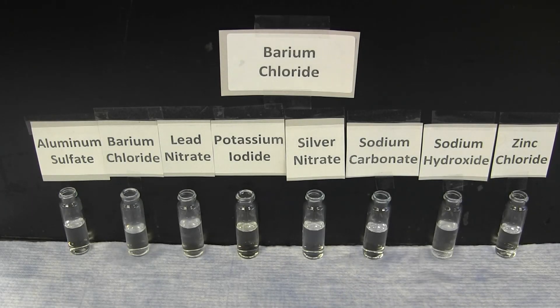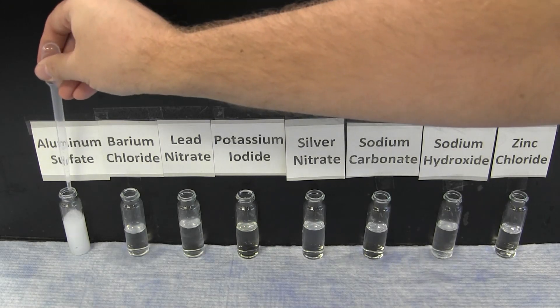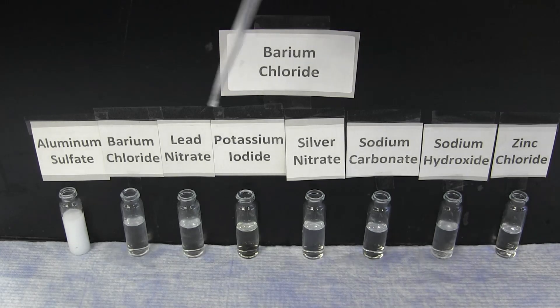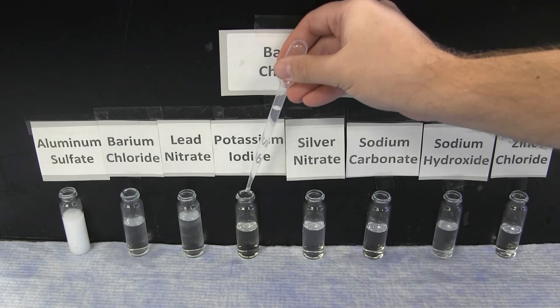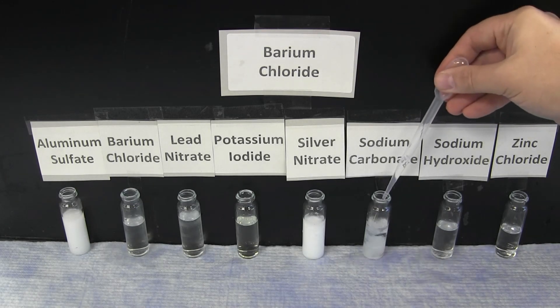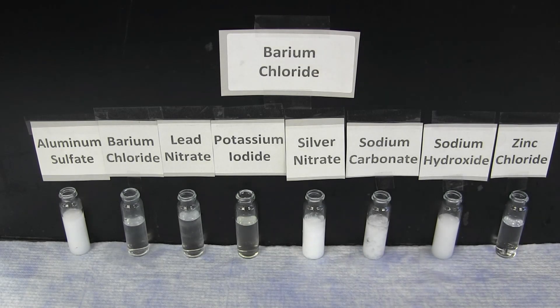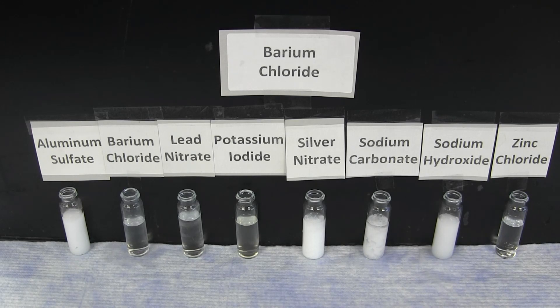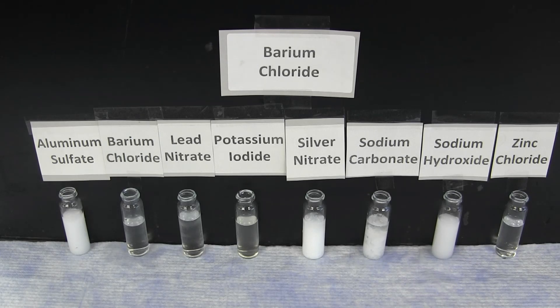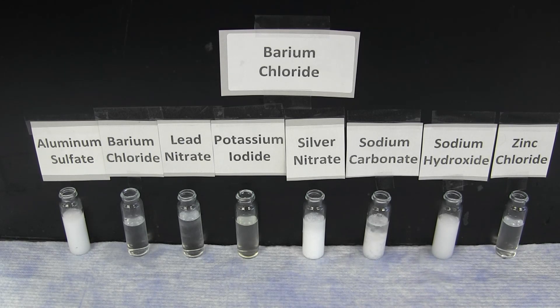The next pattern to observe is the reaction pattern of barium chloride. Barium chloride gives a bright white precipitate with aluminum sulfate, silver nitrate, sodium carbonate, and sodium hydroxide. There is no reaction with lead nitrate, potassium iodide, or zinc chloride.